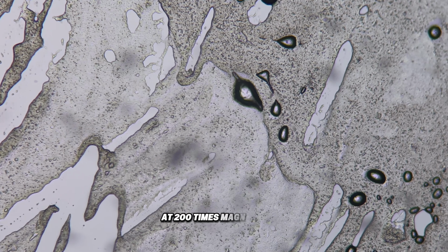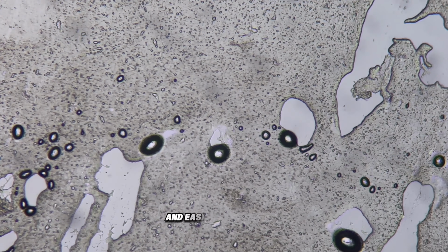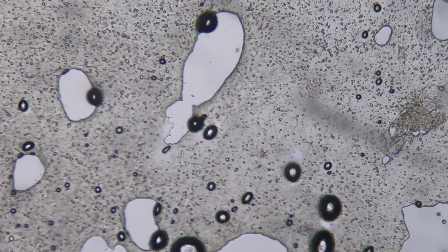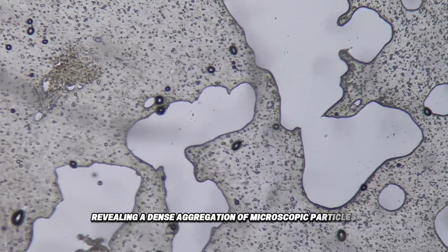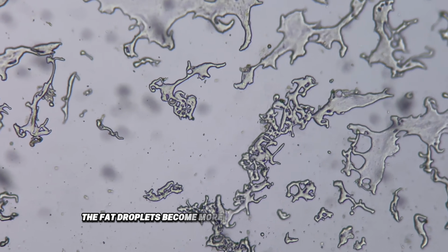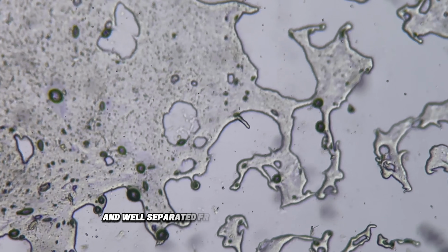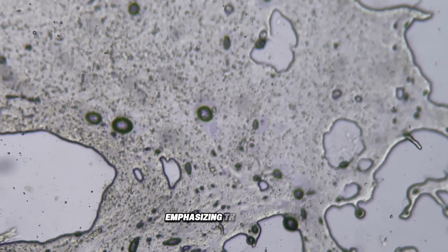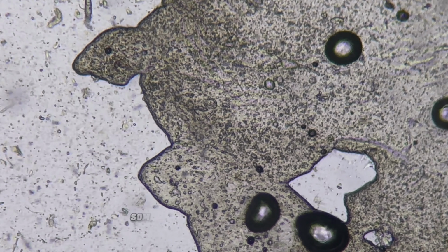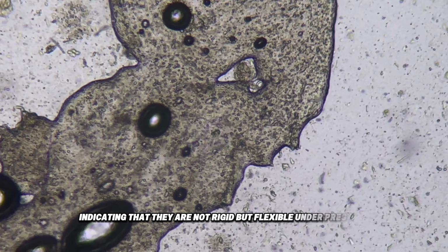At 200 times magnification, the internal composition becomes significantly more detailed and easier to distinguish. The darker regions now break into smaller components, revealing a dense aggregation of microscopic particles tightly packed with minimal empty space. The fat droplets become more defined and visually dominant. Their edges appear smooth and well separated from the surrounding material, emphasizing their softer, liquid-like nature compared to the rough protein structure. Some droplets begin to deform slightly, indicating that they are not rigid but flexible under pressure.